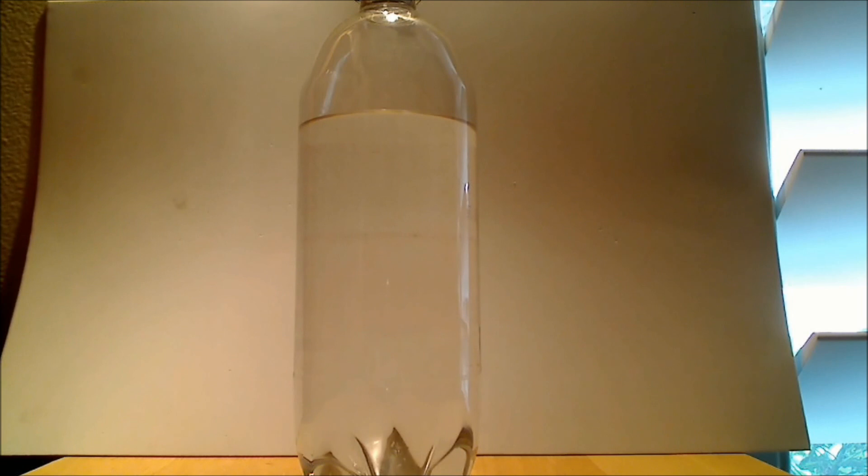And the top phase will be the less dense phase, which is almost pure isopropyl alcohol. And the bottom phase is a salt water solution. And it's more dense, so it's on the bottom. And you can see the phase boundary starting to appear.